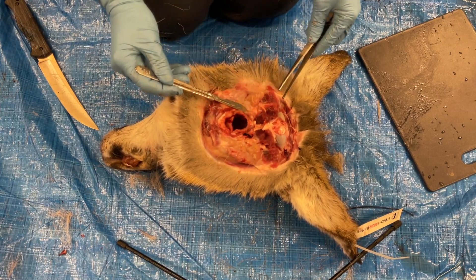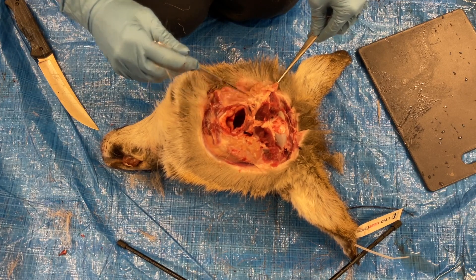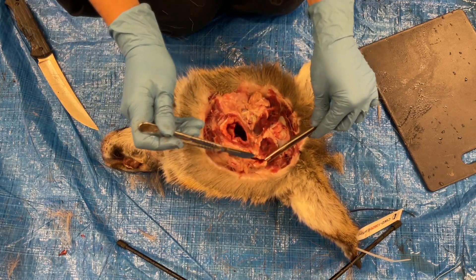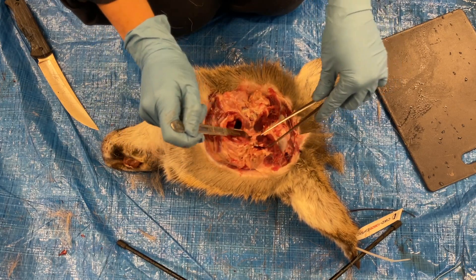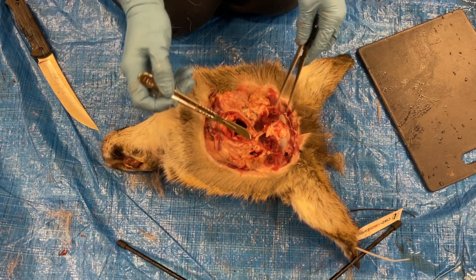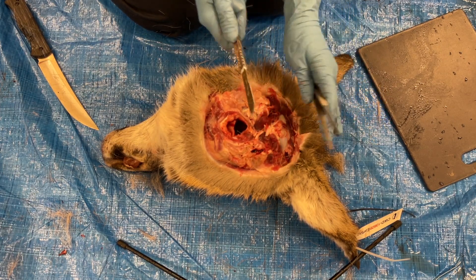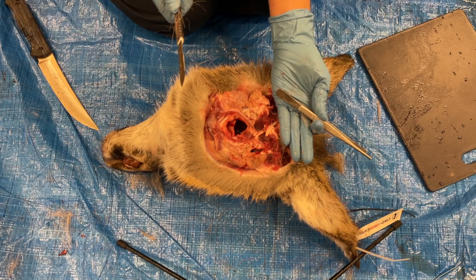resembling chewed bubblegum, whereas the lymph nodes are a single smooth, often gray colored node. The lymph nodes will be close to the salivary gland on either side of the head, located in this fatty area. They are located in front of this muscular tissue in between the base of the skull and the trachea.